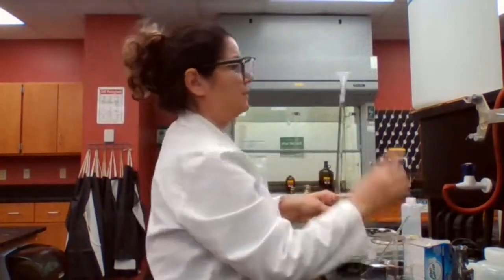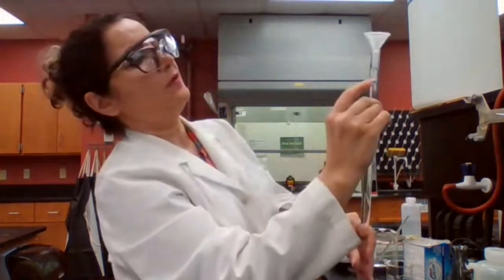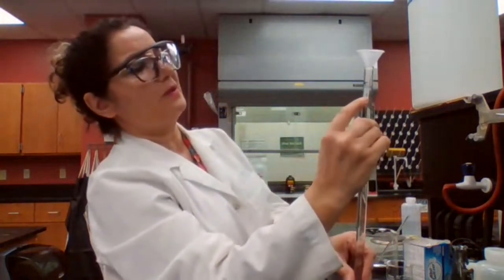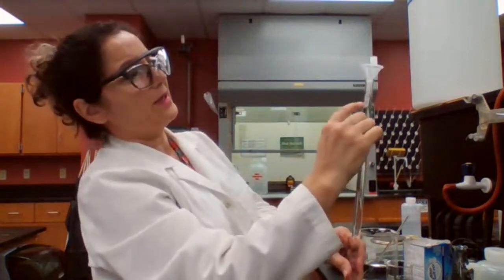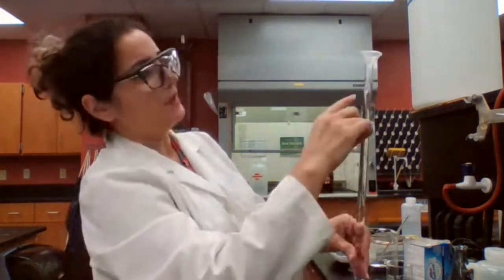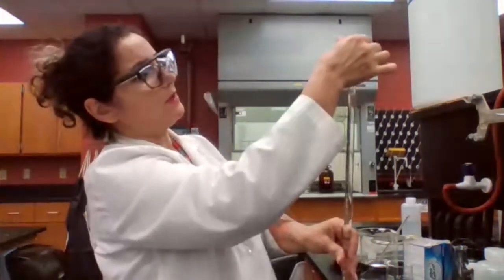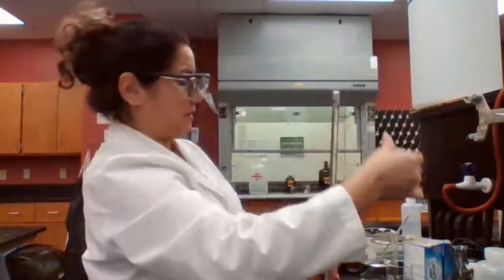I put it higher than zero. We worked with this for experiment one already a couple of times, so the graduation lines start from zero and go down to 50. So I put liquid higher than zero, to make it higher than the level of zero.